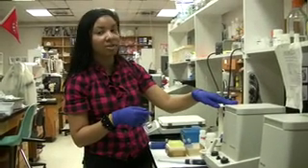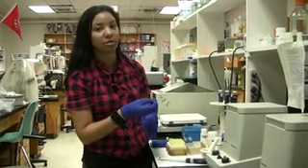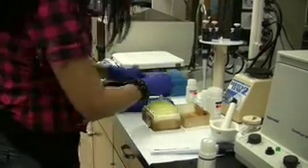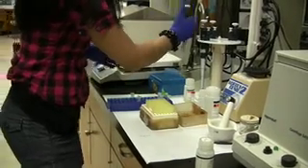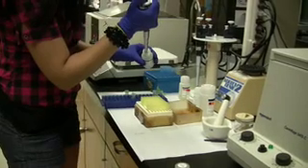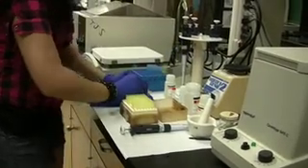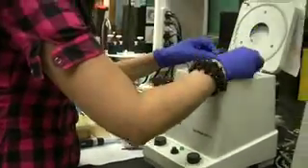When we take it out of the centrifuge, we will discard the collection tube — all the flow-through that's in it, we'll discard it. We already discarded the flow-through and now we're placing it into the collection tube. Once placed, I'll add 500 microliters of buffer AW — it's just a wash. Close it and place it back in the centrifuge for two minutes at max speed.